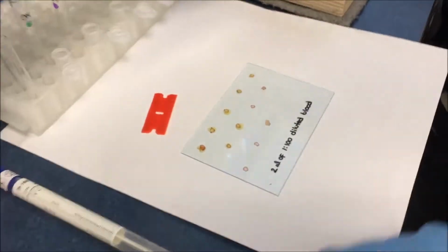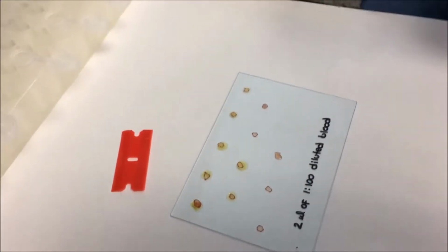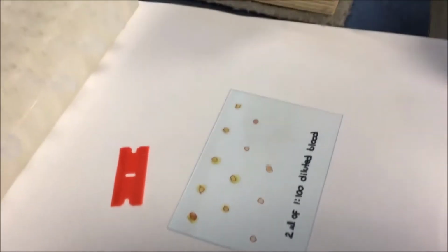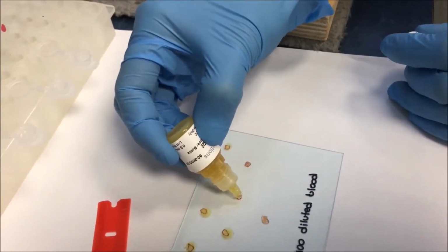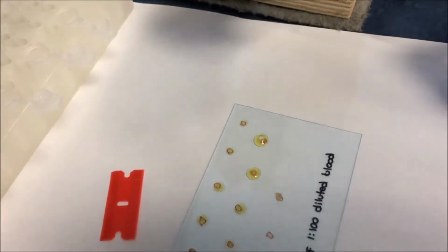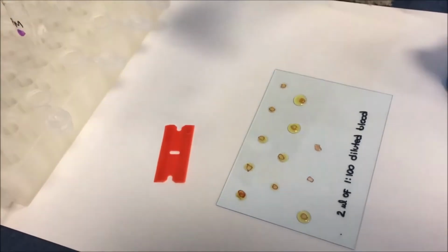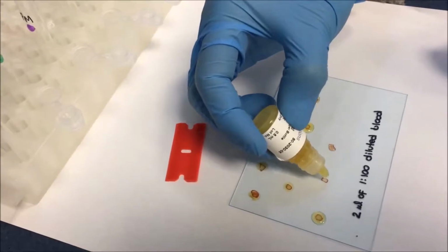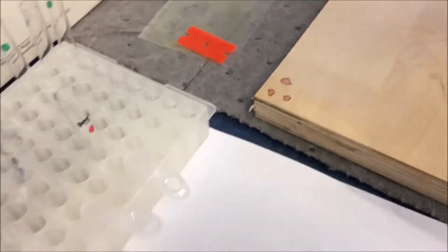What we have done prior to this session is that we have already deposited a blood sample, which was used for the swab also. We're now going to use the dropper and drop 1 or 2 drops of the Omni-Matrix, sufficient to cover the sample area. We are going to cover all the samples collected on the surface of the area. Similarly, we will do it on the wood surface and on the metal surface.